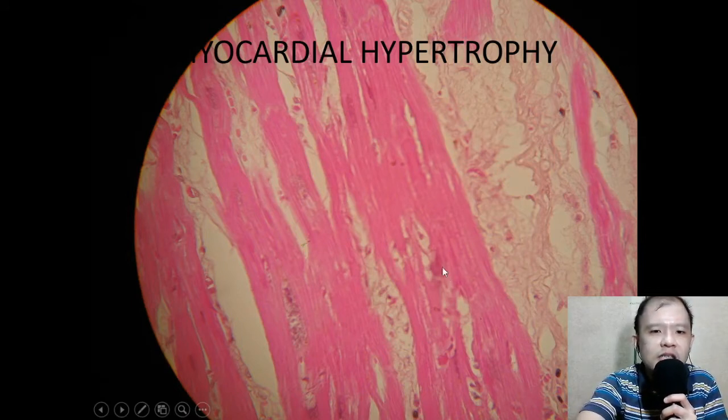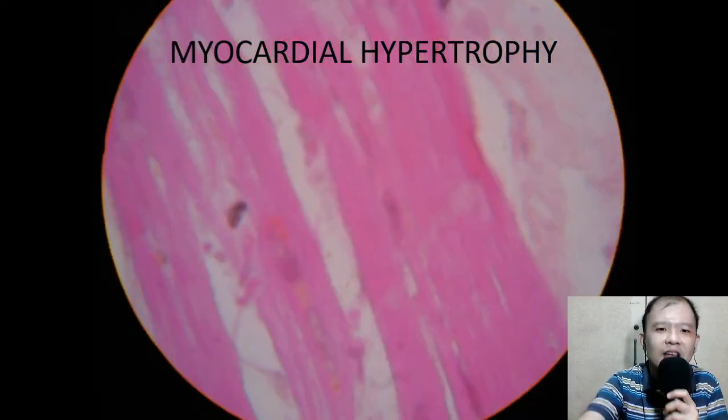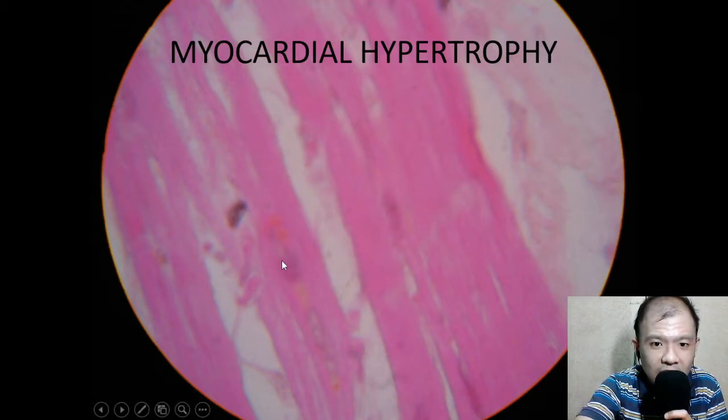So here is the slide of the myocardial fibers. What type of muscle is it? A cardiac muscle. It is involuntary but striated. This is the lipofuscin. This is the nucleus, lipofuscin, the yellow ones.